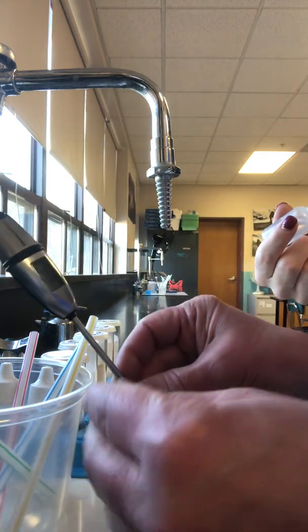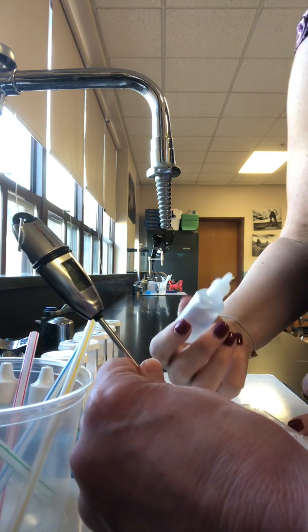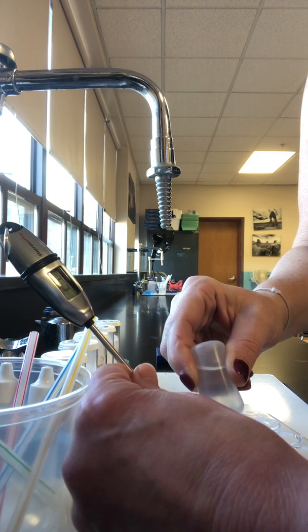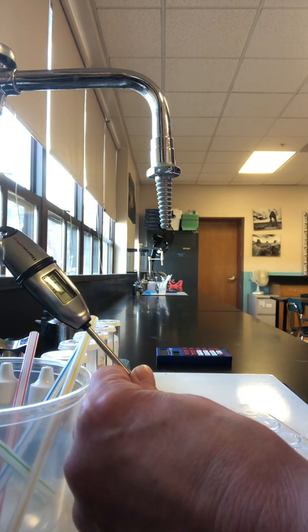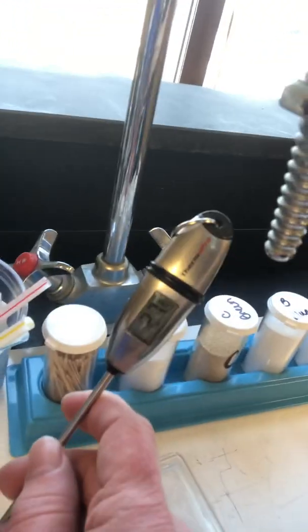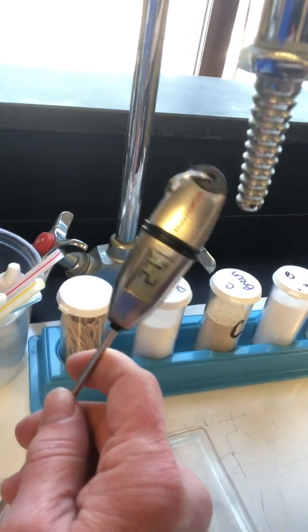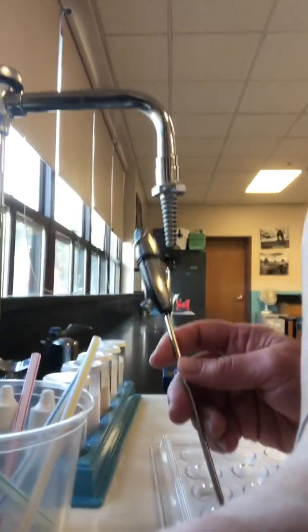Alright, for the first one, probably don't want to hold the thermometer with your fingers. Okay, ready? 1, 2, 3, 4, 5, 6, 7, 8, 9, 10. She's going to take the measurement. I had the kids stir. You can see, I don't know if you can see the temperature very clearly, it started at 23, and it's now climbing to 27. 27.5 is the highest. Okay, so it started at 23 degrees.